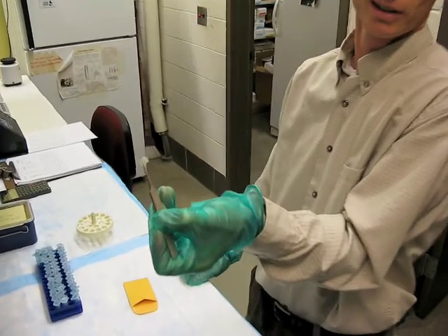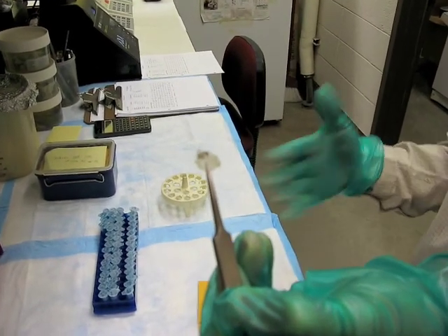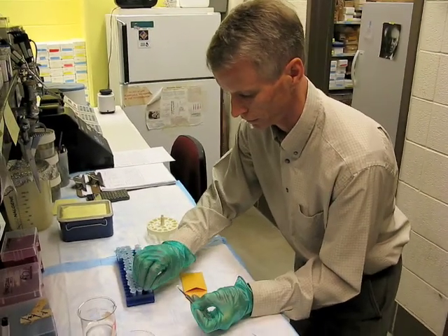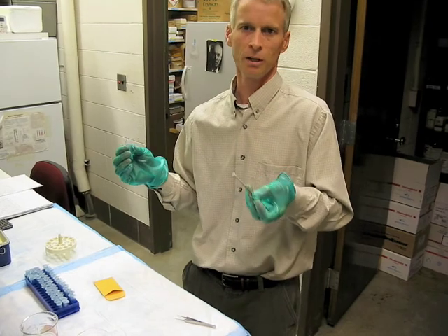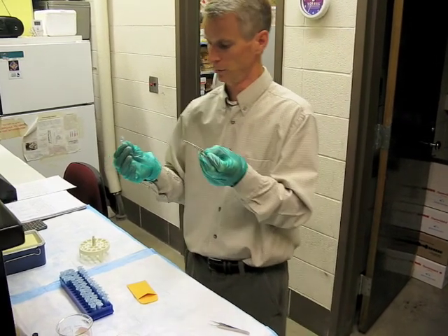The brown material — that's the skin, the coloring you'd see on a fish — gets stuck to the scale, which is really a bony part. So the DNA is especially in that tissue that's stuck onto the scale. And in these tubes, I use a real simple DNA extraction procedure that was developed actually for forensic work, where you have just a tiny amount of tissue with a little bit of DNA.